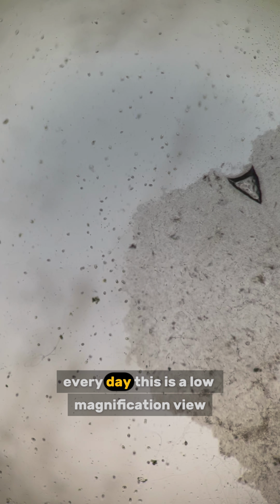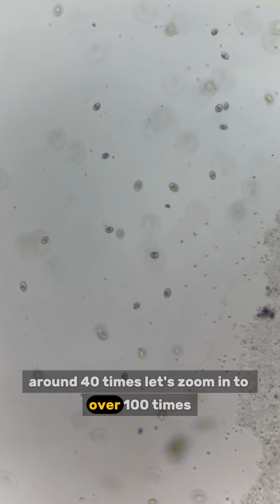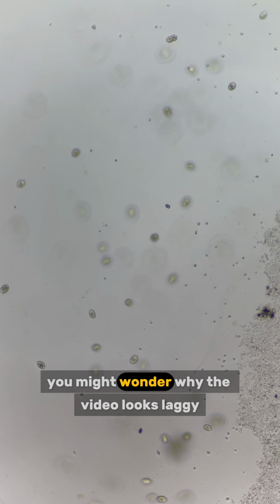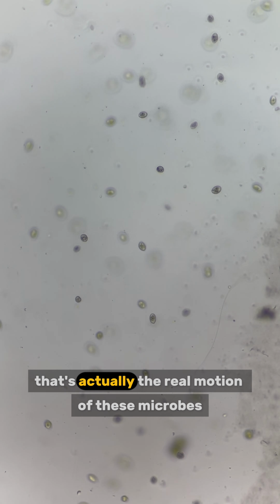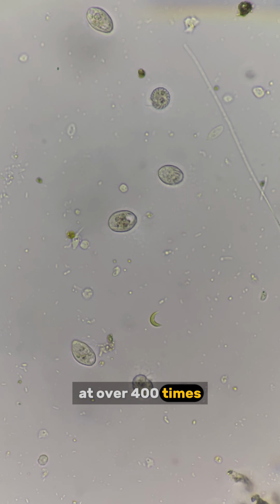Day 86 of creating a microbial sandbox by adding random stuff and observing it under the microscope every day. This is a low magnification view, around 40 times. Let's zoom in to over 100 times. You might wonder why the video looks laggy. That's actually the real motion of these microbes. Weird, right?